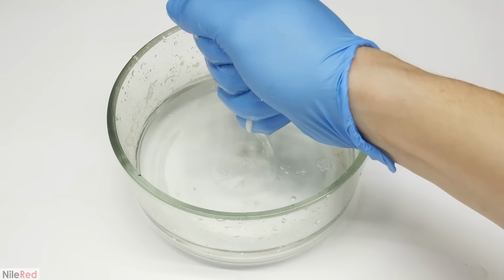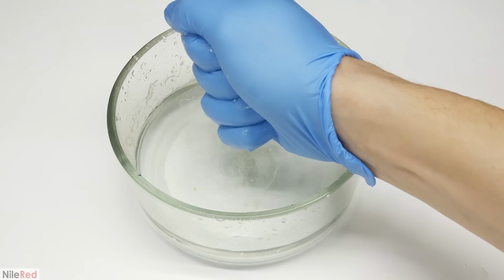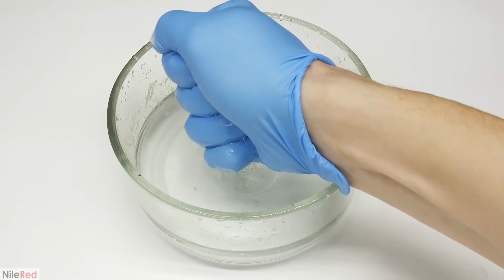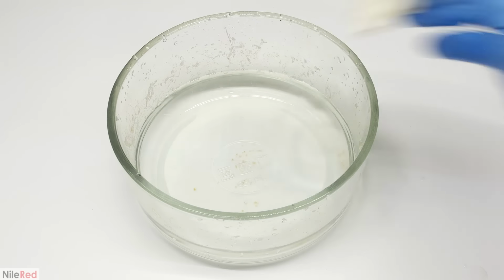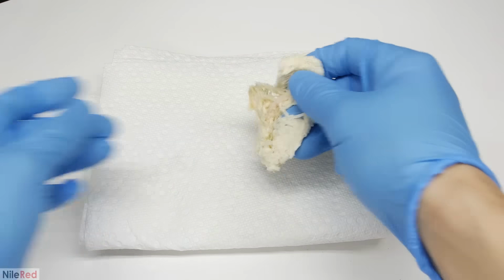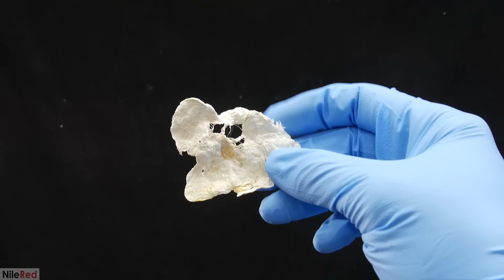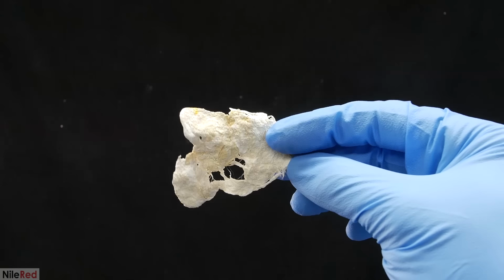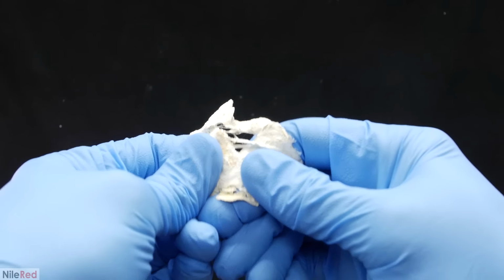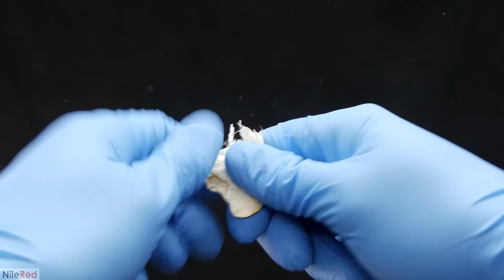I personally didn't do it, but to clean things further, it might be an idea to do a dilute acid and a dilute base wash. Anyway, the nylon was taken out and squeezed tightly to get rid of as much water as possible. I then spread it out on some paper towel and let it dry for a couple days. When I came back, I had some nice and dry nylon with a mass of about 0.75 grams. It was a little bit tough, but still quite easy to break apart using my fingers.